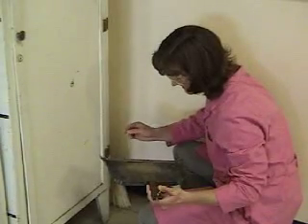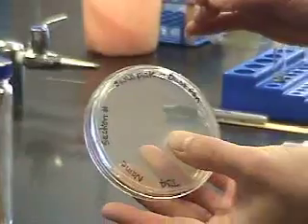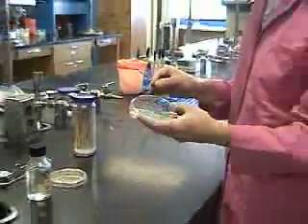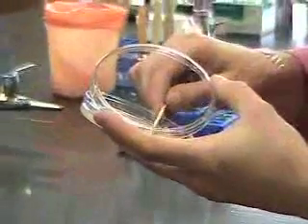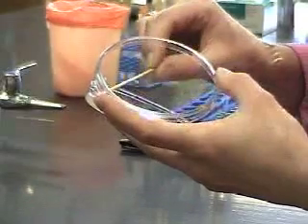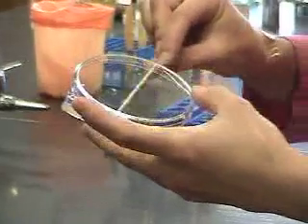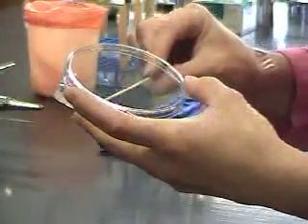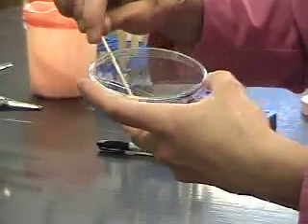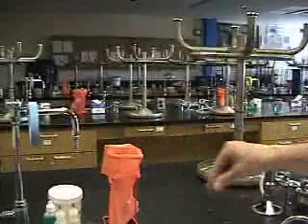Now you can go to any fun location you'd like — for instance, the dustpan. Now we're ready to inoculate the agar. Grab your plate and lift the lid just ever so slightly, hovering above the surface of the agar so that not too many aerial contaminants can reach that agar. Rub the swab across the agar several times, back and forth, inoculating the entire surface of the plate. Discard your swab in the biohazard bag located conveniently on your desk.